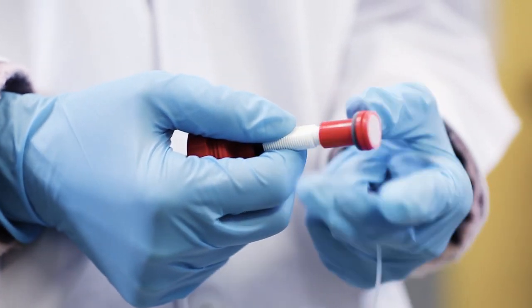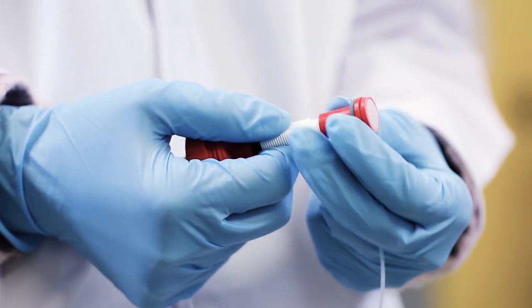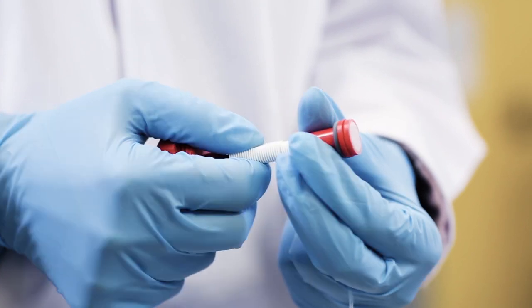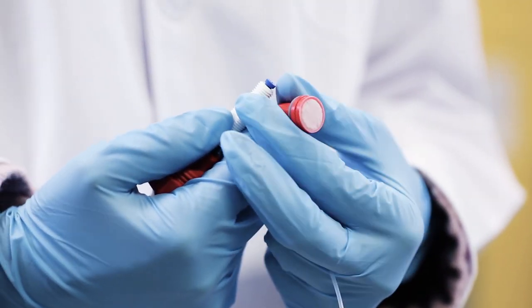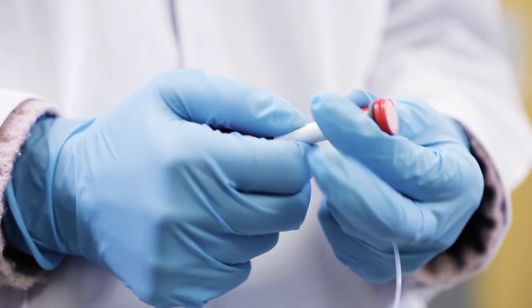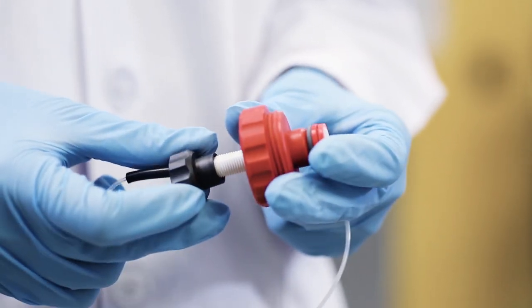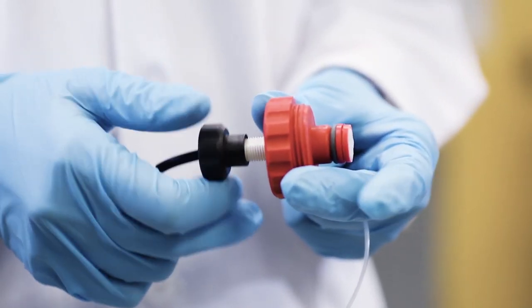Also inspect the nets. Unscrew the plunger from both the bottom piece as well as the adapter. Inspect the ferrule and tubing. The tubing must be securely fastened. Reassemble the bottom piece and adapter.